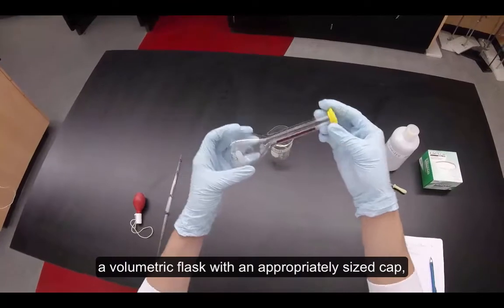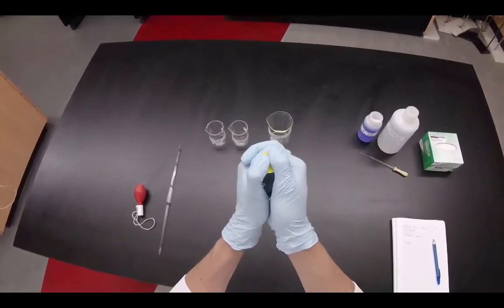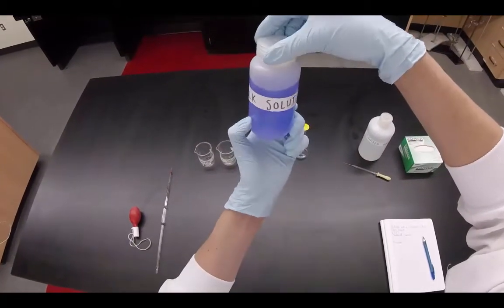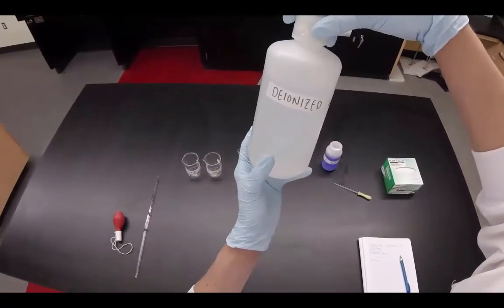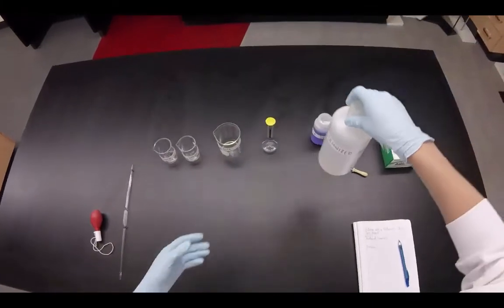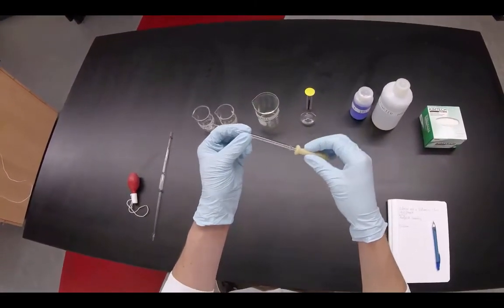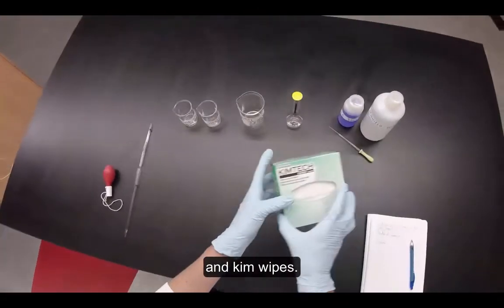You will also need a volumetric flask with an appropriately sized cap, your stock solution that you'll be diluting, deionized water, a small pipette, and kim wipes.